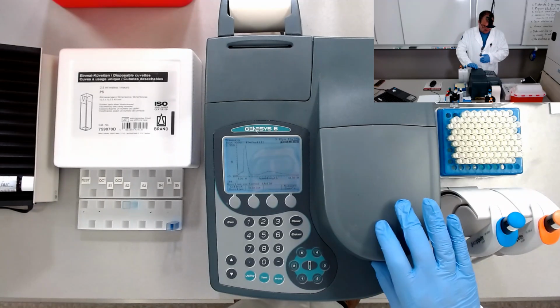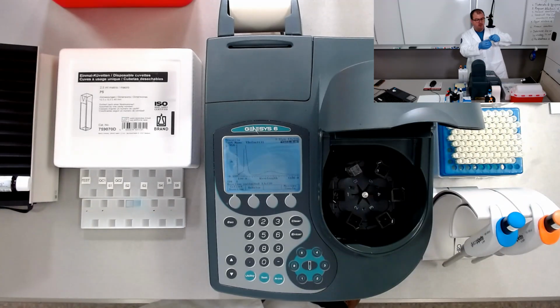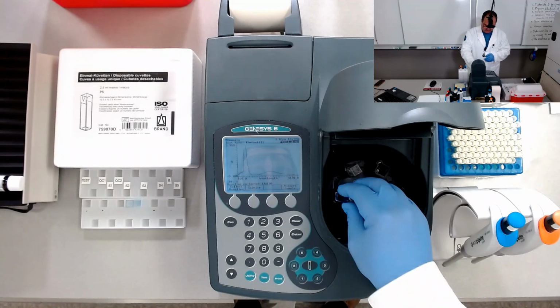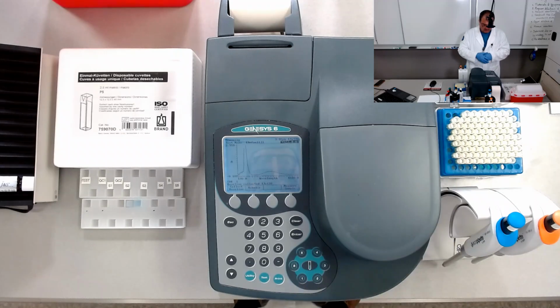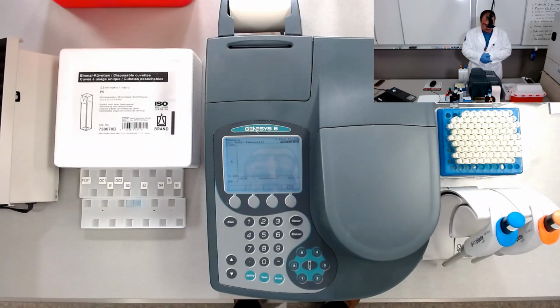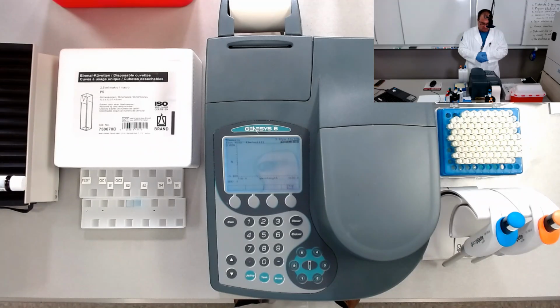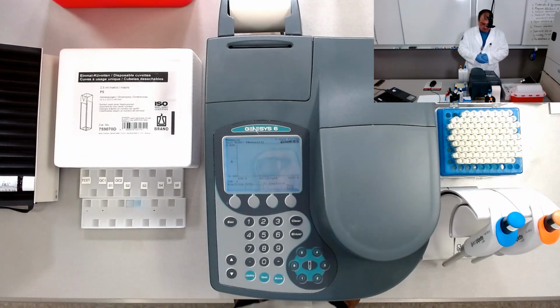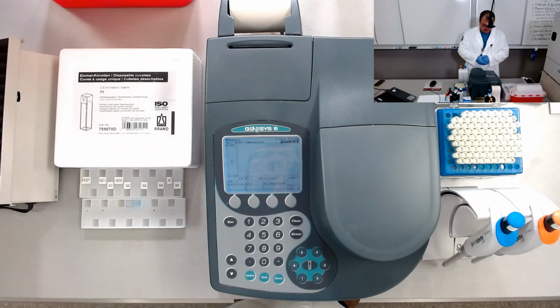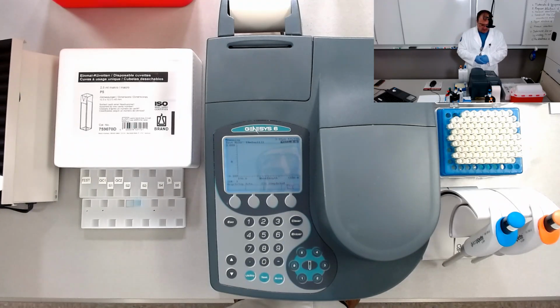Now we need to place the sample in position 1, right? The light beam comes this way. Okay, so measure sample. Now it will start plotting the absorbances from 1100. So that's the starting point towards 190 nanometers.